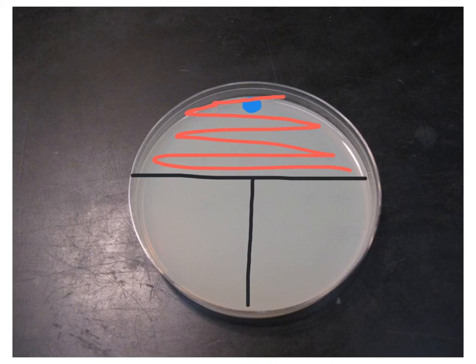After I have done that, I will place the lid back on the petri dish and flame my loop again. I'm going to flame the loop because the purpose of doing this is to dilute this bacteria. Because I have bacteria on my flame loop, I need to sterilize it so that when I move my flame loop over here, I start off with no bacteria on my flame loop. I'm picking up the bacteria here and then spreading it out and diluting it down further. I make sure that the loop has cooled down so as not to kill my bacteria.